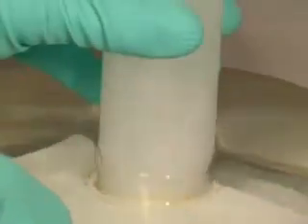In each compound, the halogen has a valency of one. All four compounds are gases, and they're also very soluble in water. Here's water swallowing a jar of hydrogen chloride.